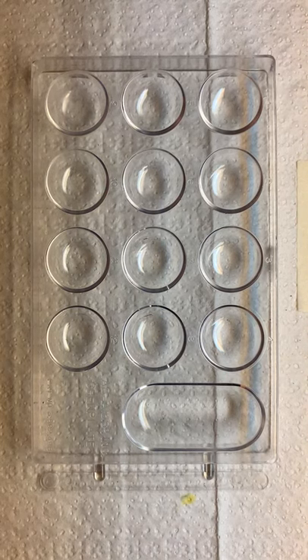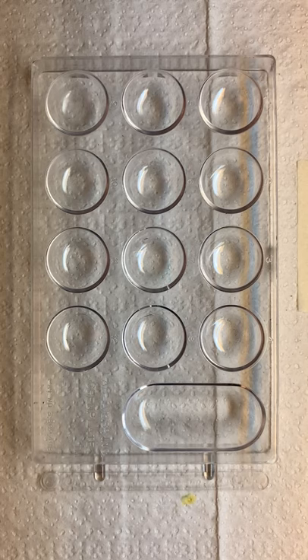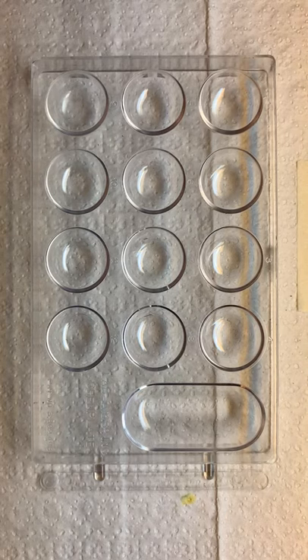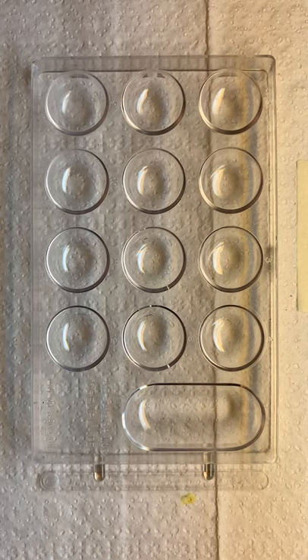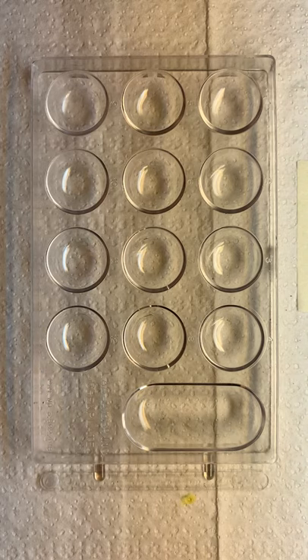Now we're at Activity 3 and we're not going to rinse this one out if you're doing this along with me in the lab. We're going to hang on to this one as our key. So the most important thing about Activity 3 is don't rinse this tray out. Just hang on to it after you do it.